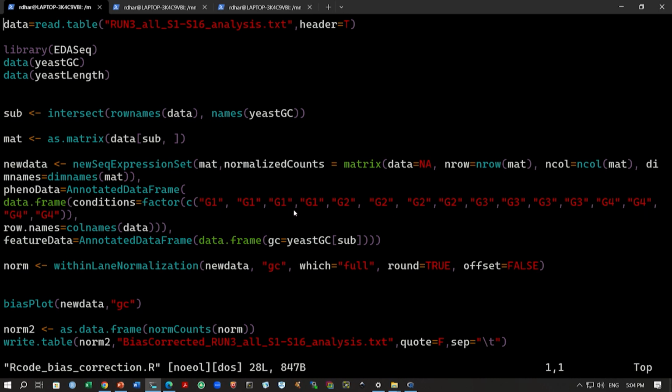Then you have the row names, which are the row names given for this data frame. This will be the data variable that you have loaded, the column names of that data. These are the sample names, which will be the row names in the case of phenotypes. So that is the pheno data, and then you have the feature data, which belongs to this yeastGC sub. This is based on the GC content, so we are looking at GC content here.